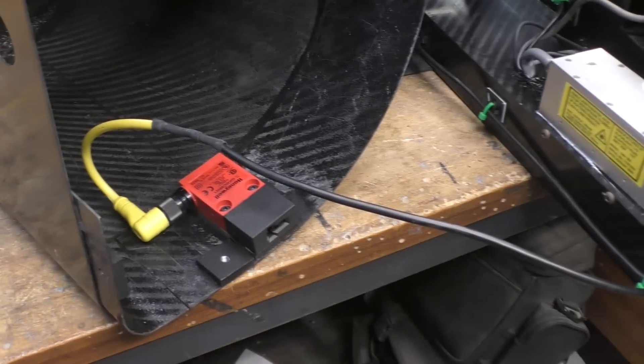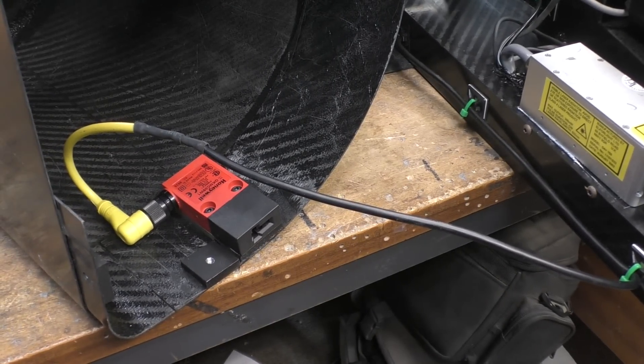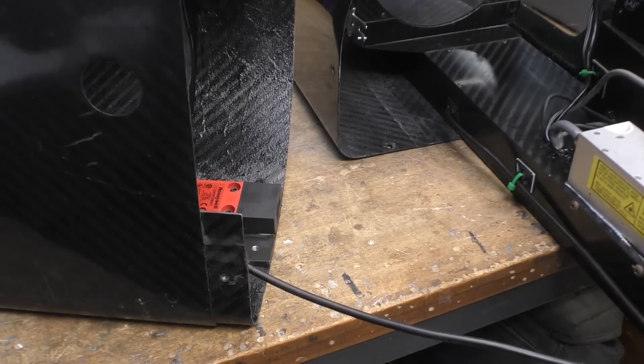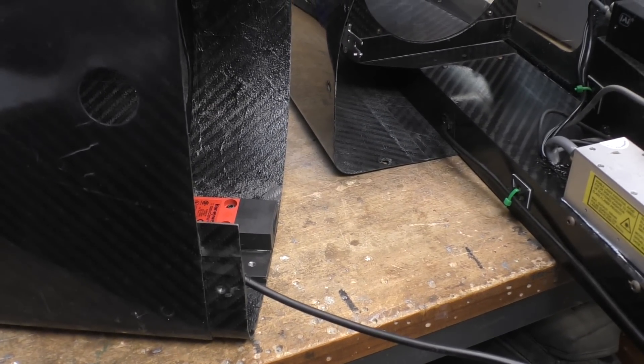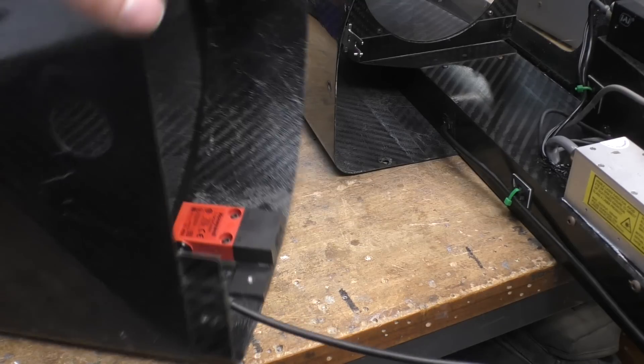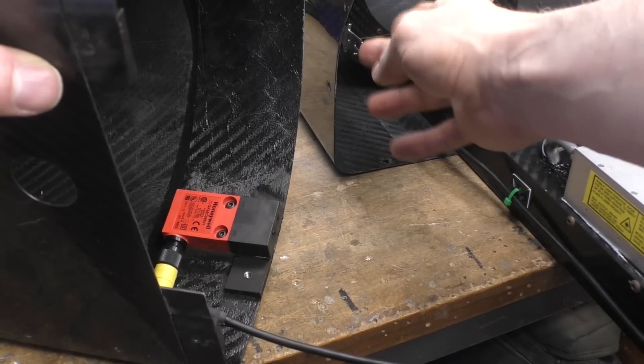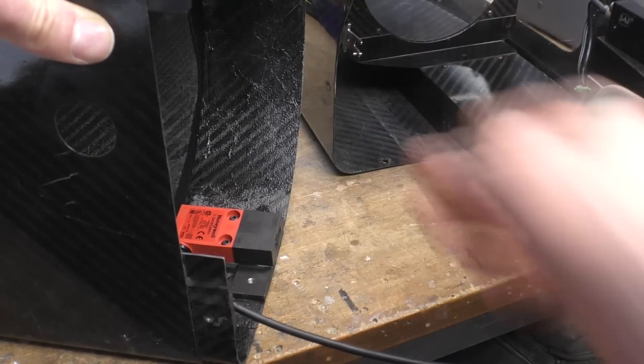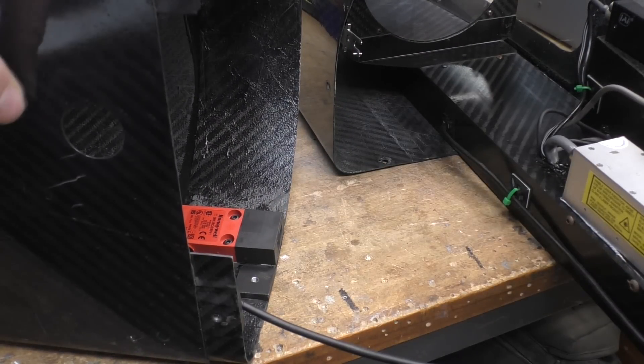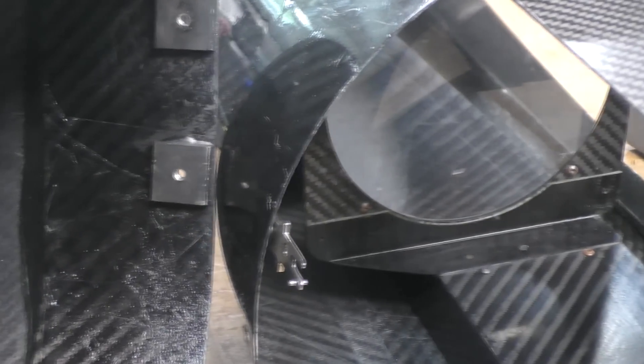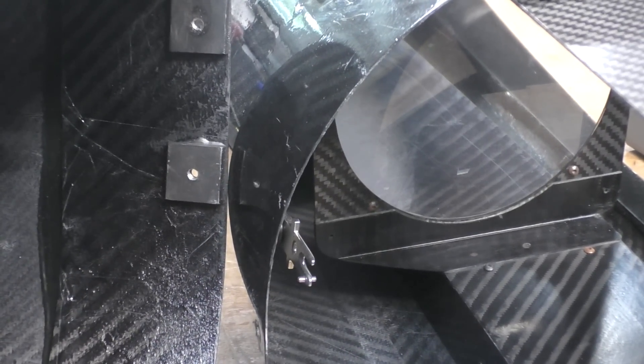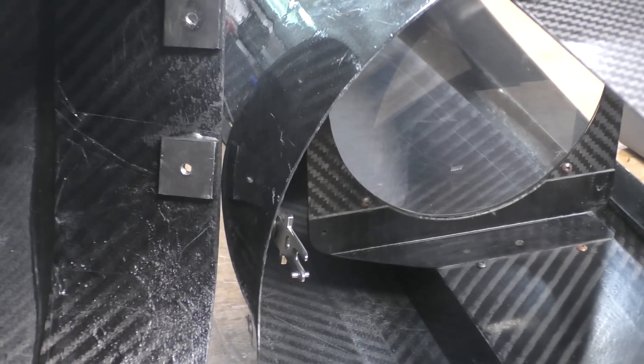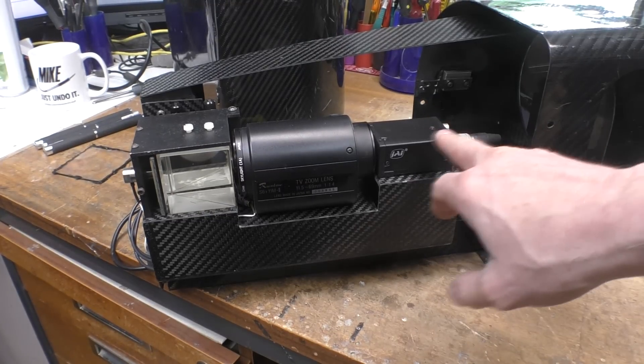Here we've got this industrial interlock switch. This is a fairly elaborate safety interlock type switch clearly here to make sure it shuts the laser off when you open it. This is like an industrial thing with a specially shaped interlocking post that slots into here to enable it. The design looks fairly elaborate - probably a combination of making sure it's very reliable but also difficult to bypass by shoving a screwdriver in.